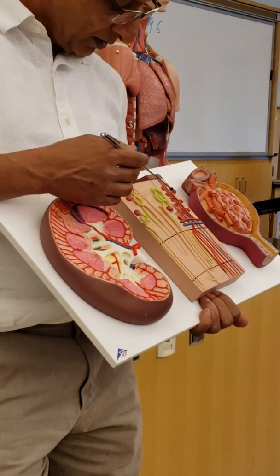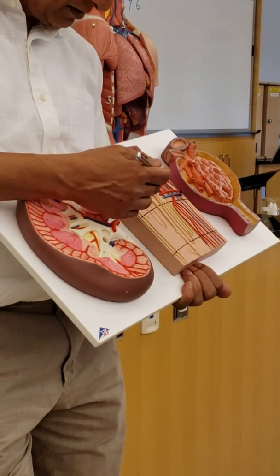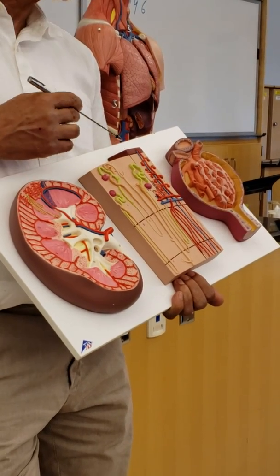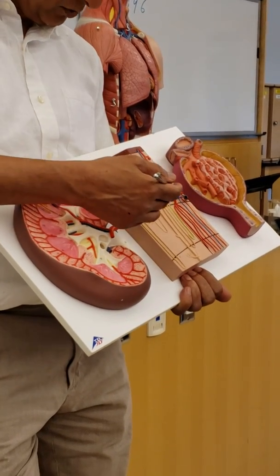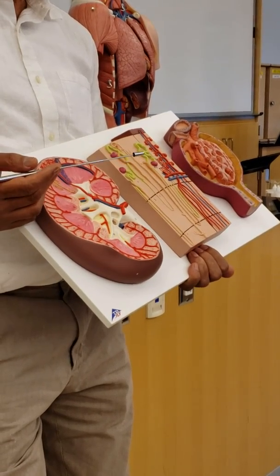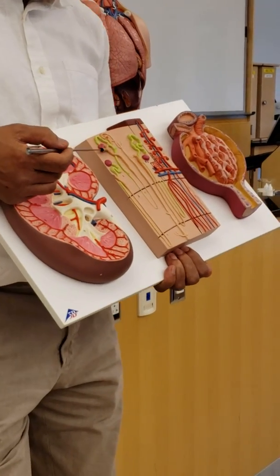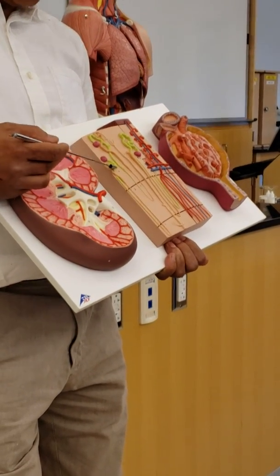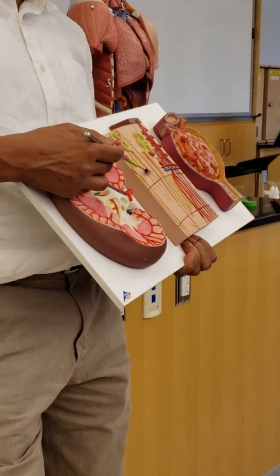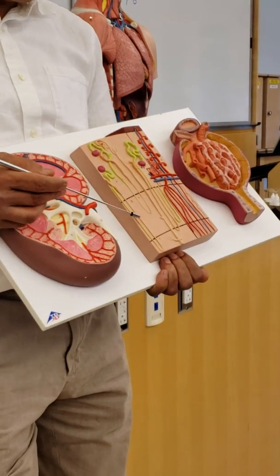And it doesn't show the other one. So this is the vein, the arcuate vein, and so on. So this part is cortex, this is capsule. And below this line is the medulla. Alright? So, in this nephron, this is one nephron and the nephron. Which one is this? What kind of nephron? This versus this.